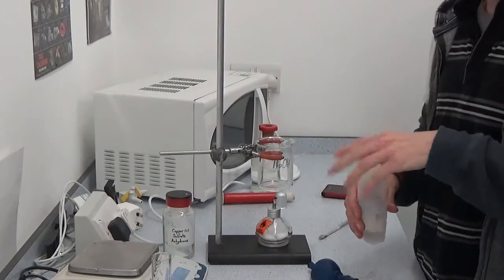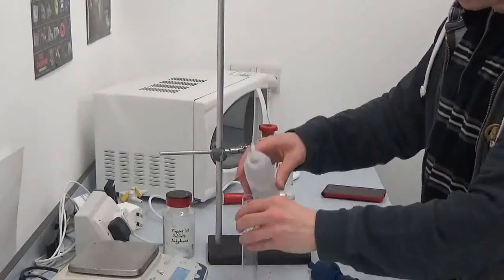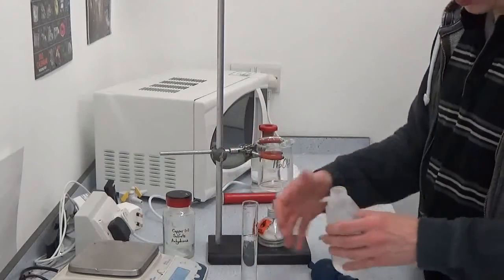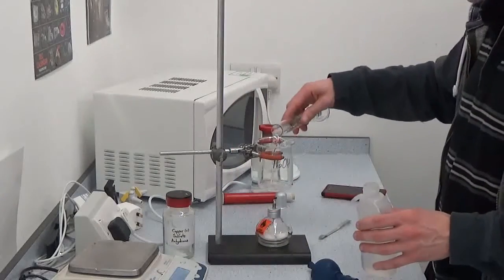So get a measuring cylinder, record your water. So about 50 cubic centimeters there.